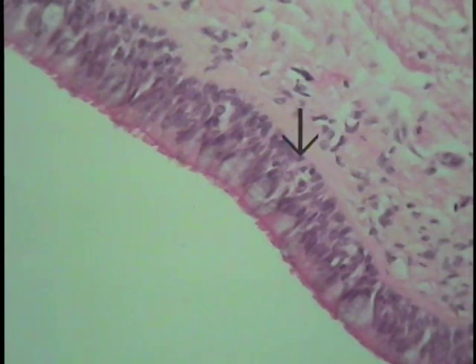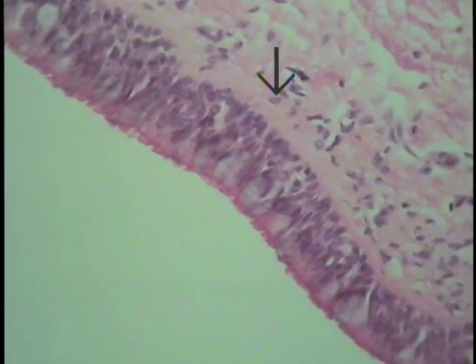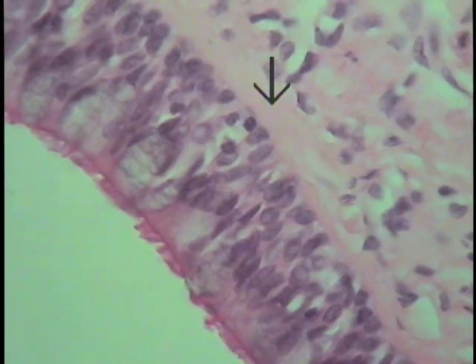Even at this magnification, one can make out cells that look a little bit different, lighter, with a flocculent type of material within their cytoplasm. These are goblet cells, also found within the trachea. We had looked at one earlier lining the intestinal tract. Examine this particular epithelium at increased magnification. Typical pseudostratified columnar epithelium lining the trachea.